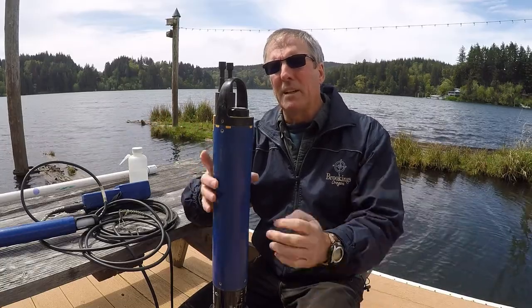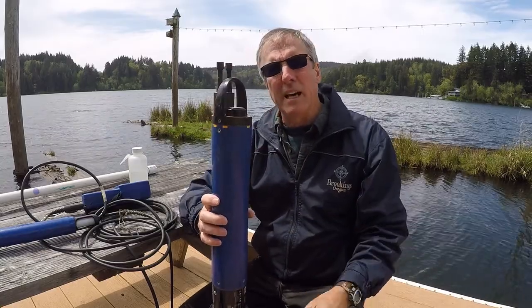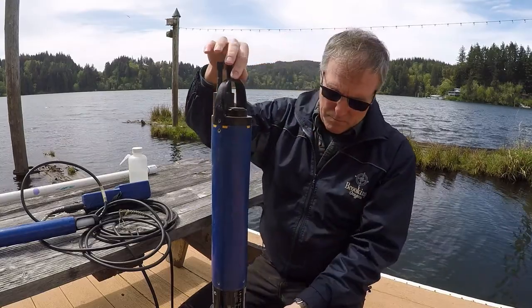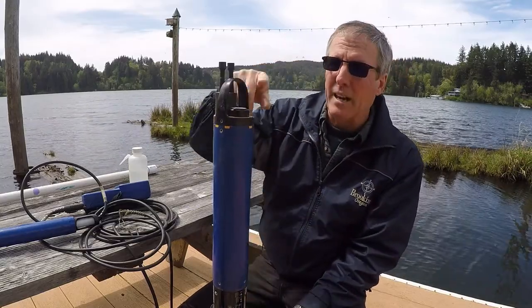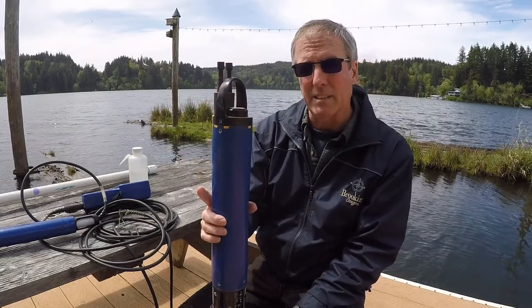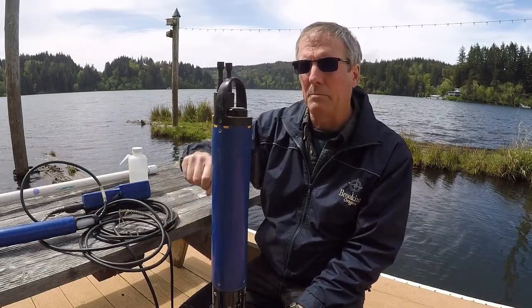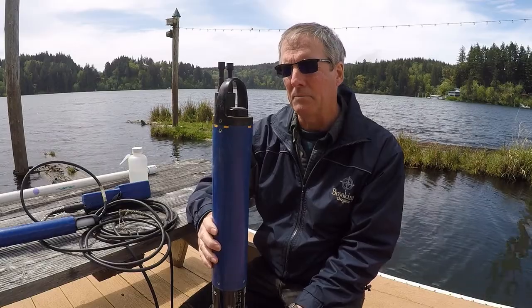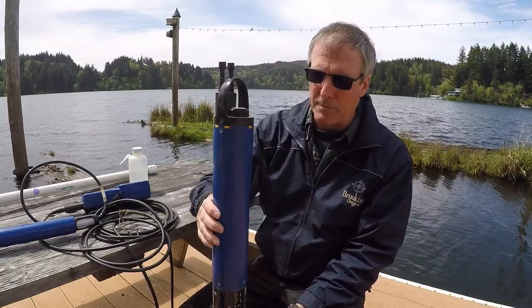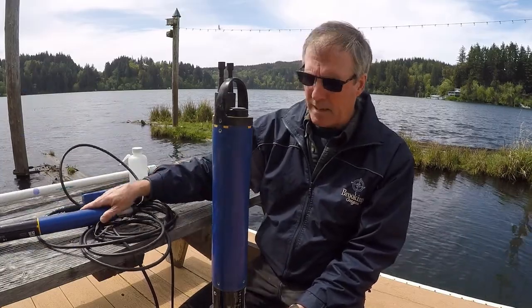You then usually attach this to a line that is metered, so that you tie a rope on here. The probes are down here, so you take that into account when you're trying to find your depth, which is another thing that this does automatically, is tell you how deep the probe is. That's really handy. You don't have to keep track of it so manually as you would for the multi-parameter probe.